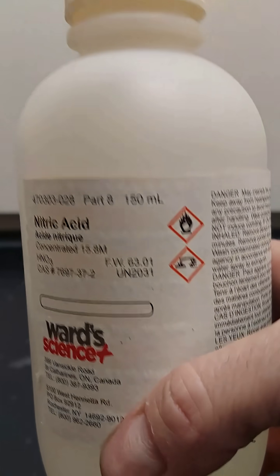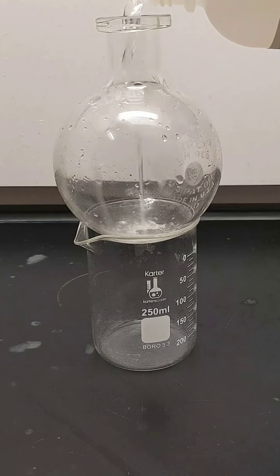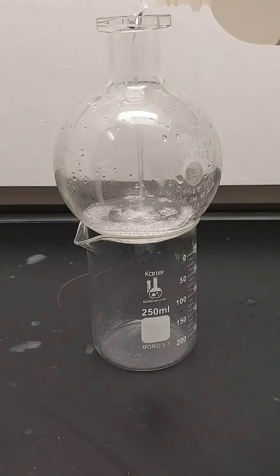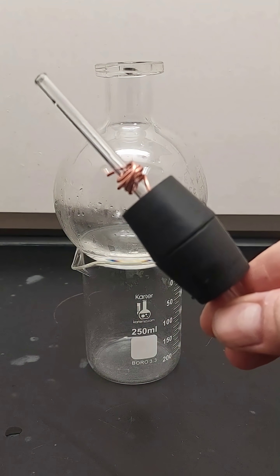Now of course, since we're using concentrated acid, please do not try this at home. This demo is an excellent way to showcase several chemical phenomena, the first of which is the reaction between nitric acid and copper.